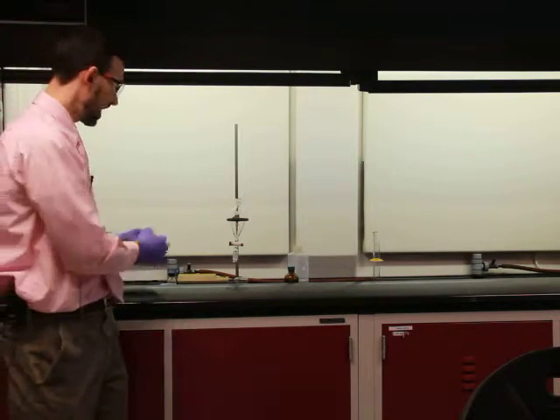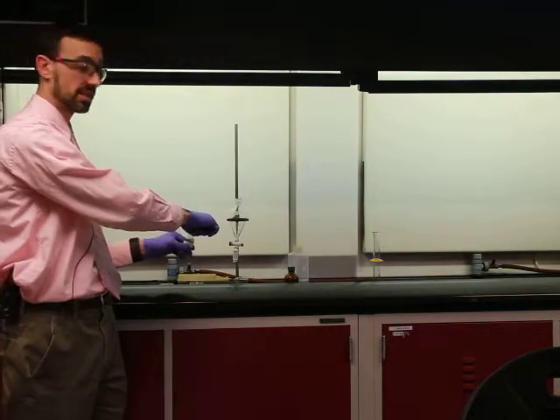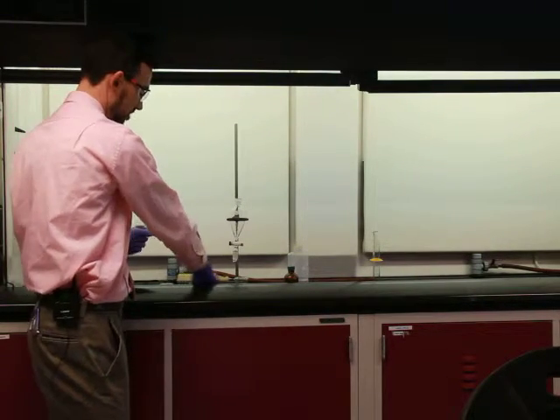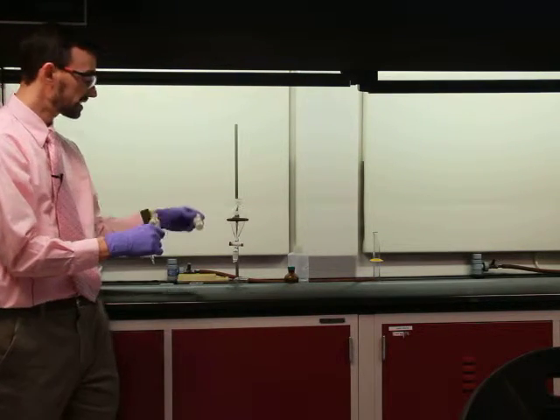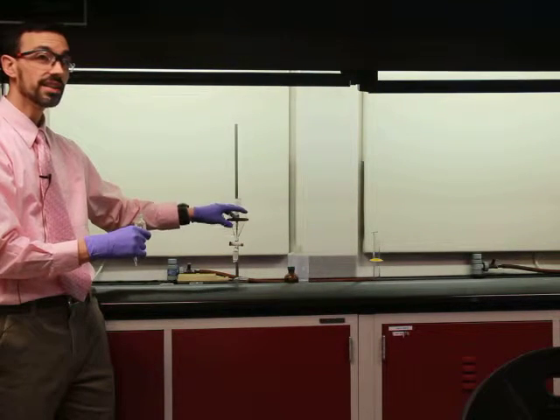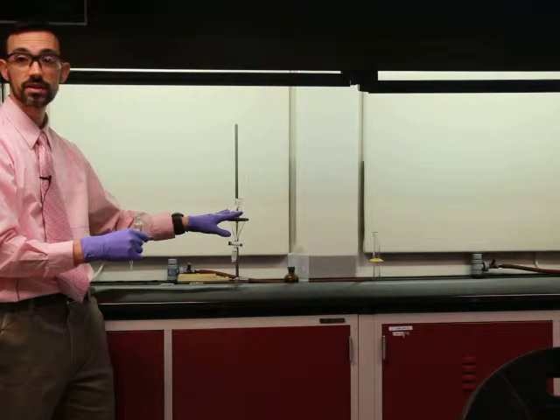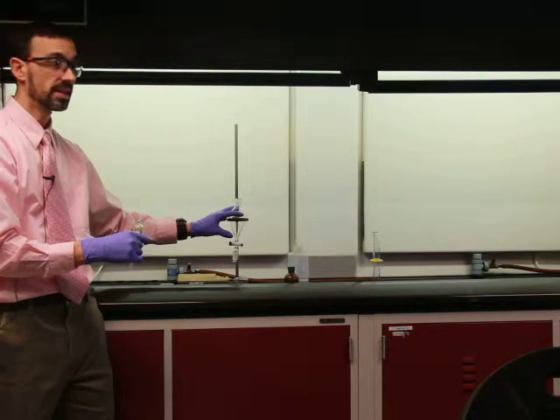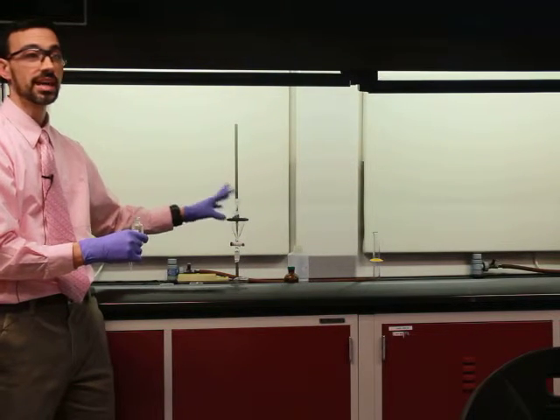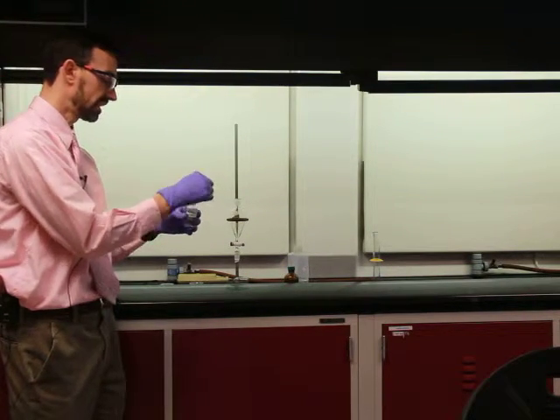And so I can just add concentrated acid, hydrochloric acid, back into this. And what that should do is precipitate out the acid, because my acid wasn't by itself soluble in water. If I started this over, ether was the first liquid I put in, and everything dissolved into the liquid, right? If I put water in there at the start, nothing would dissolve.